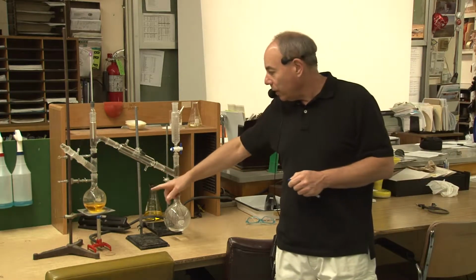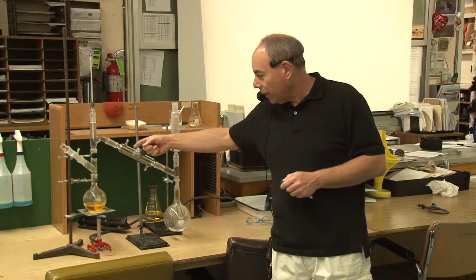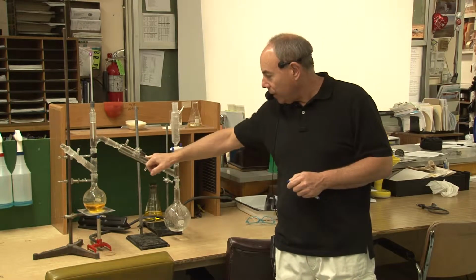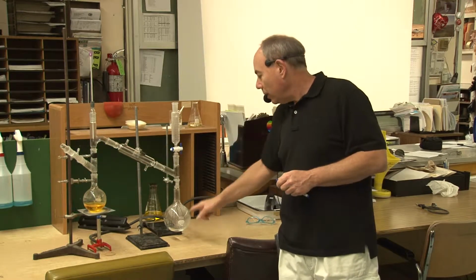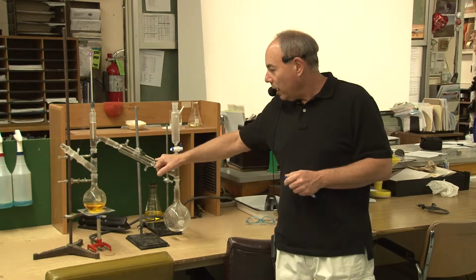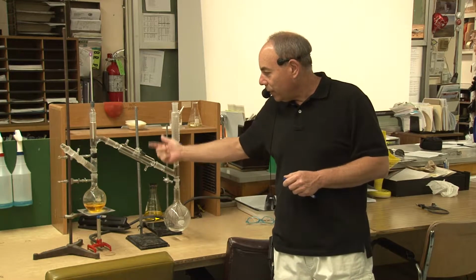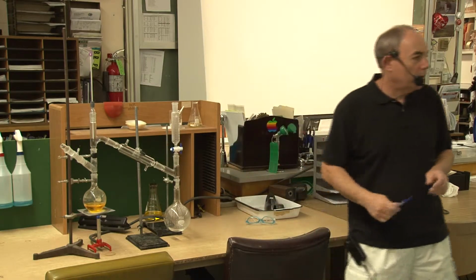Right, okay. It would be a lot more efficient if I had water, the water jacket filled with circulating liquid here. There's an inner tube in here that's actually continuous from the boiling flask into the receiving flask, and an outer jacket that you can circulate water around the inner tube. But I don't have a water hook up here and it wastes a lot of water. You just end up wasting water all day long. Are there any questions?